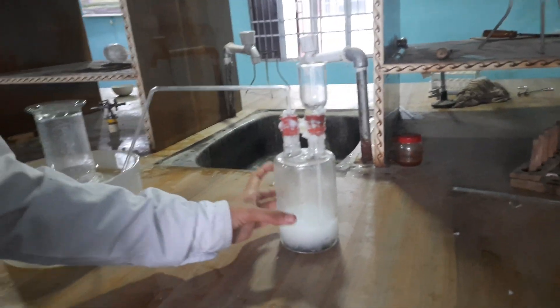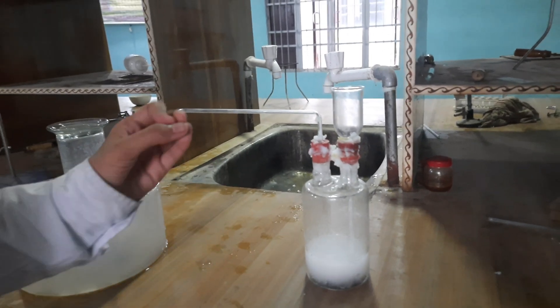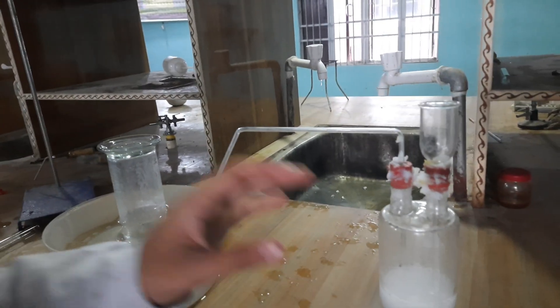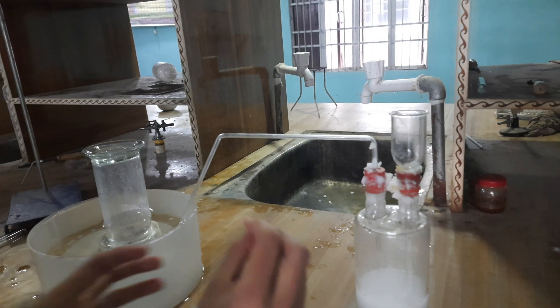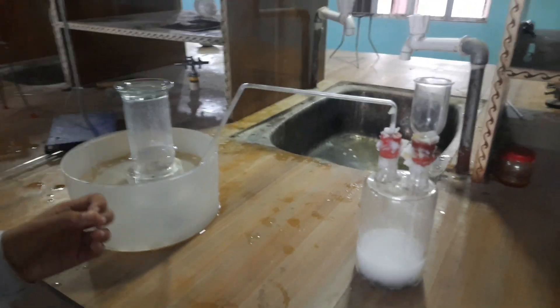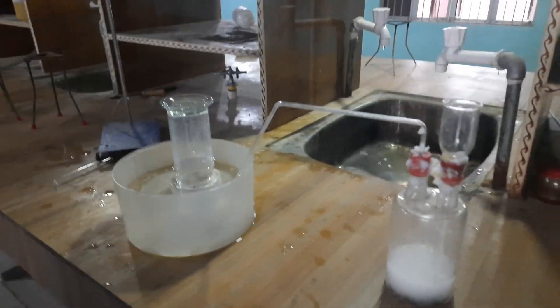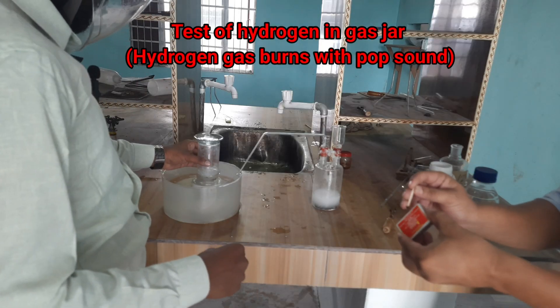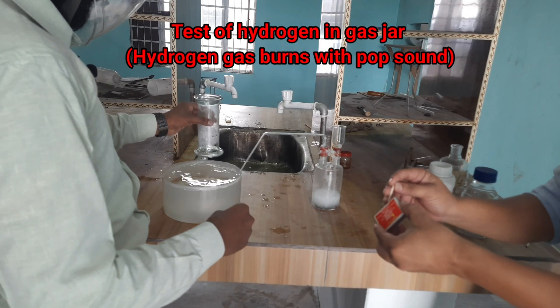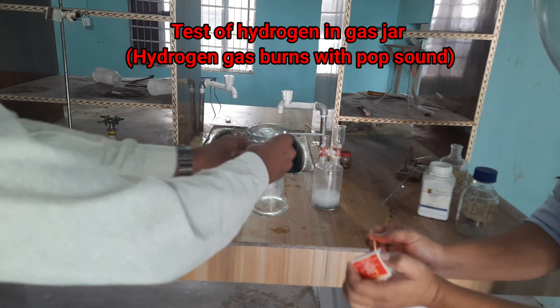Inside the Woulfe bottle there are some pieces of zinc granules and the acid. We have applied wax in order to make it airtight, to prevent air from going outside. We are going to test the hydrogen gas — let's see if hydrogen gas has been collected or not.